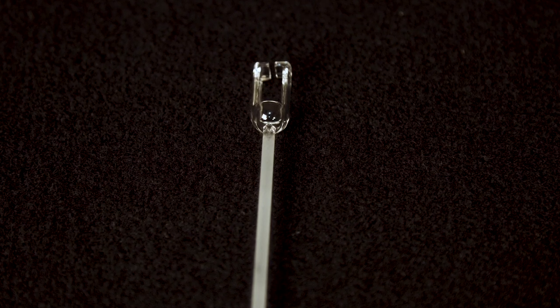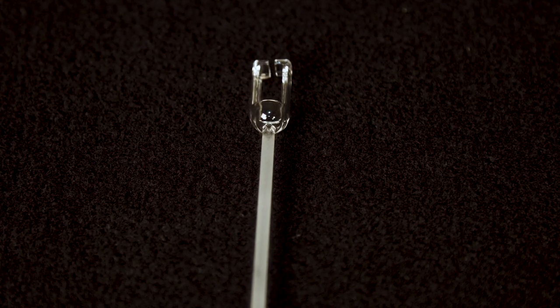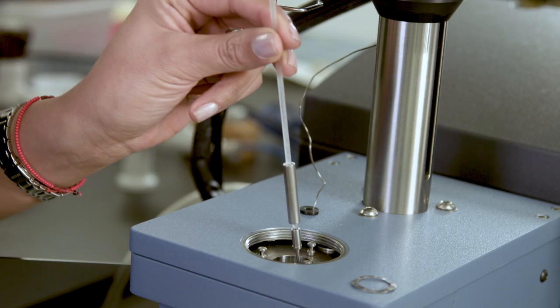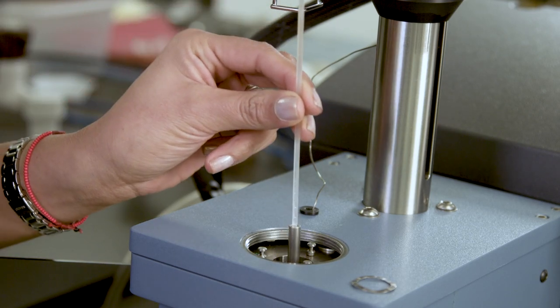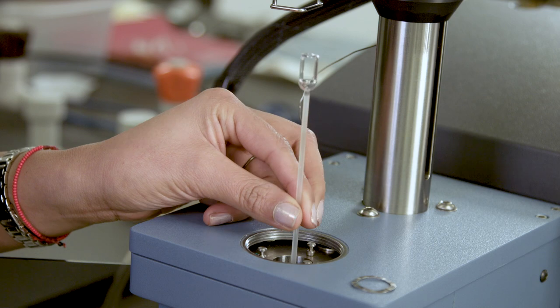The special configuration of the film fiber accessory requires installing the probe before the stage. To do so, insert carefully the end of the probe into the opening in the top plate.